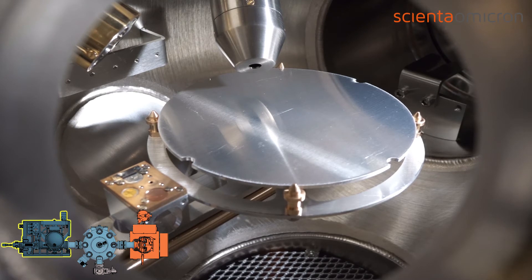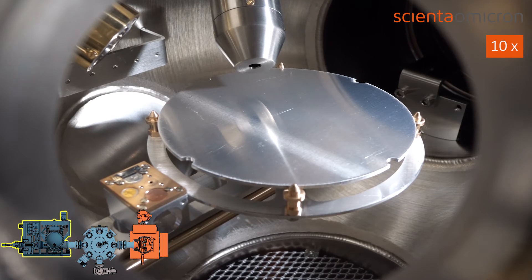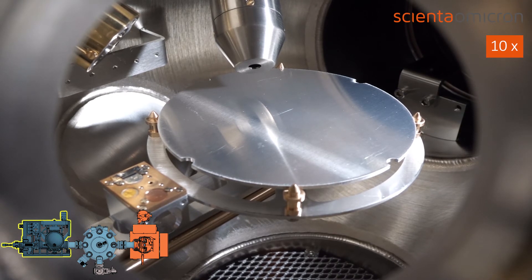When all required prerequisites, like position and pressure threshold, are satisfied, the UHV gate valve is opened and the robotic arm extends into the XPS analysis chamber.